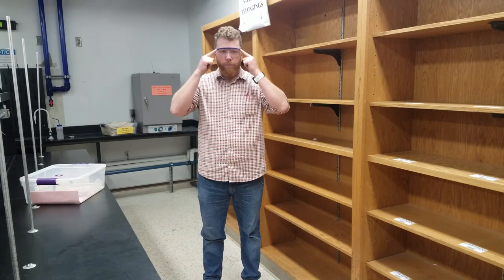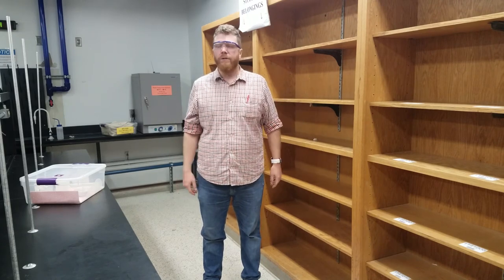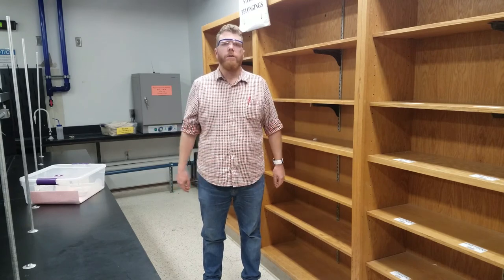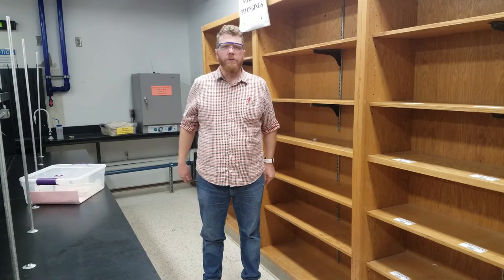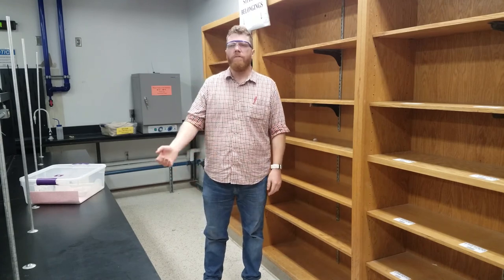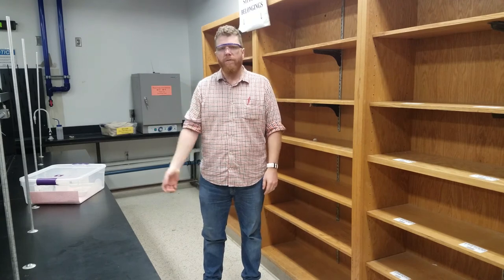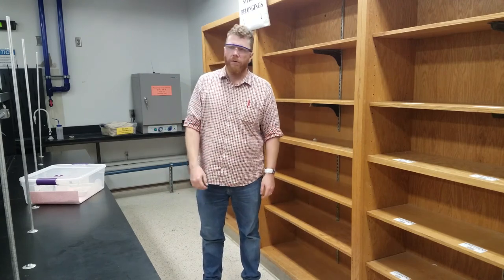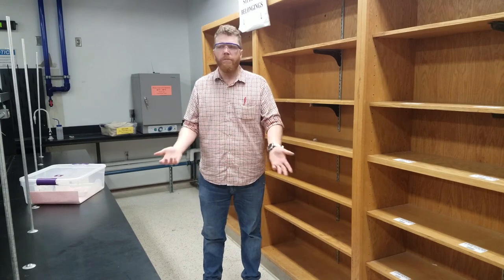And goggles — one of the most important things. I have a pair of goggles that I feel comfortable wearing for three hours or longer. If you have goggles that you have to take off every 15 minutes because they keep fogging up or they're uncomfortable, you need to get a new pair. These cost about five or six bucks. Make sure you have a pair you're comfortable wearing, because if you keep taking them off, eventually you'll forget — and then an acid could splash up in your face and get in your eye.